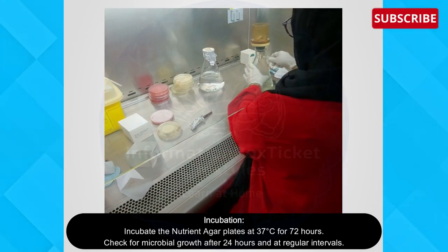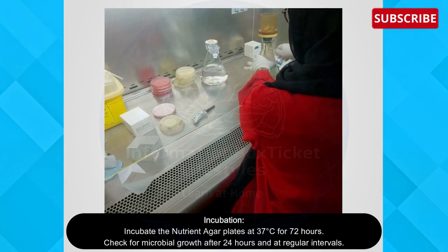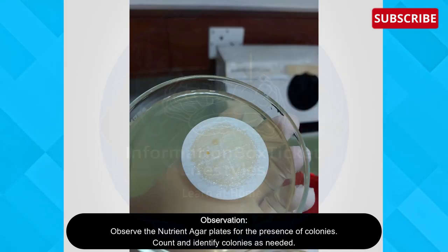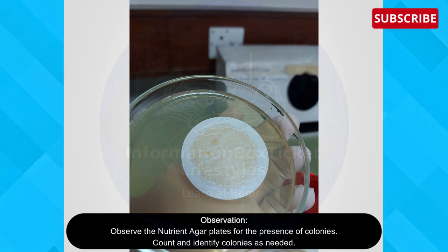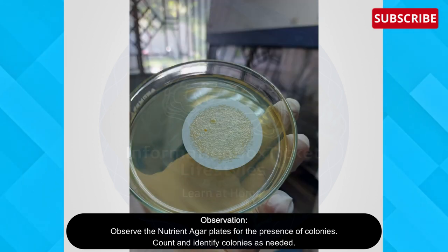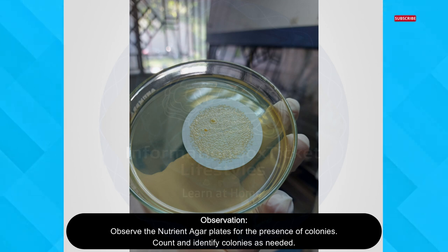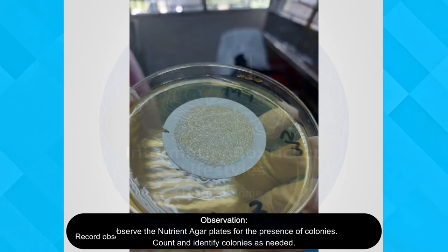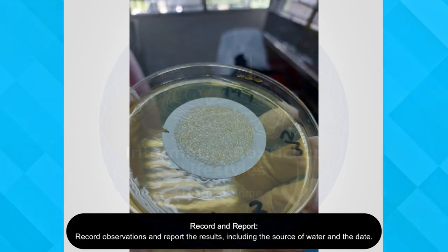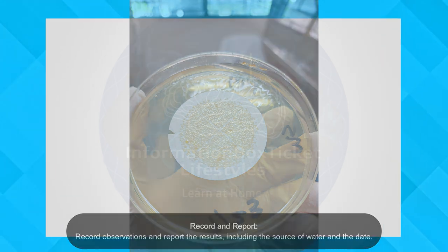Check for microbial growth after 24 hours and at regular intervals. Observe the nutrient agar plates for the presence of colonies. Count and identify colonies as needed. Record observations and report the results, including the source of water and the date.